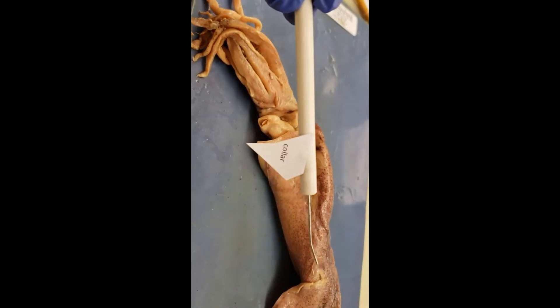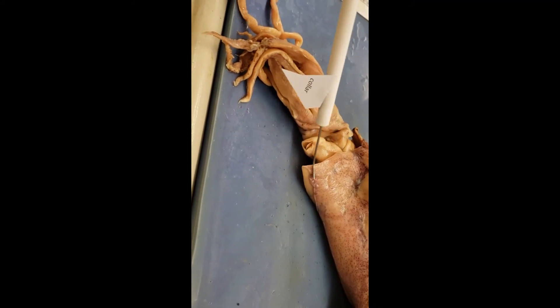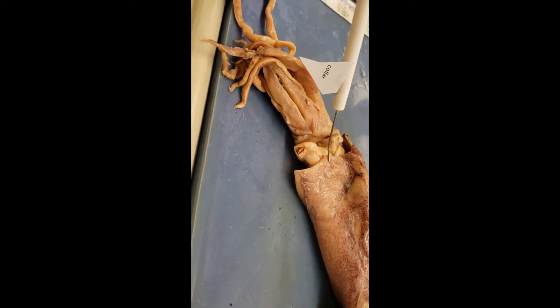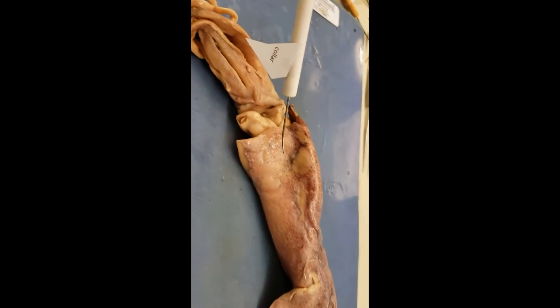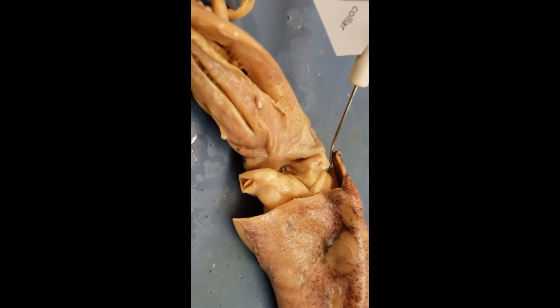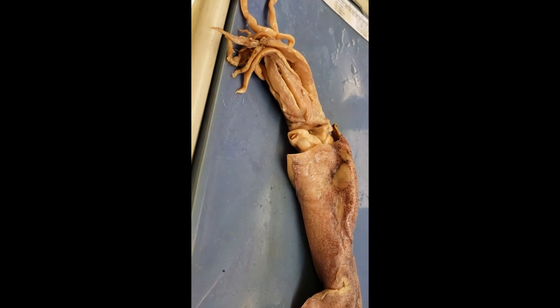Next up, the collar. The collar comes out and kind of up and above near the eyes. If you're a fan of popping the collar, so to speak, well so does this guy — it pops it. This is the collar down here. It looks like it's part of the mantle, but it's not. The collar is this little extension off of it; the mantle is further up. The collar is the part that kind of dips down and covers part of the head region. That is it for the external anatomy of the squid. Check the other video for the internal anatomy.